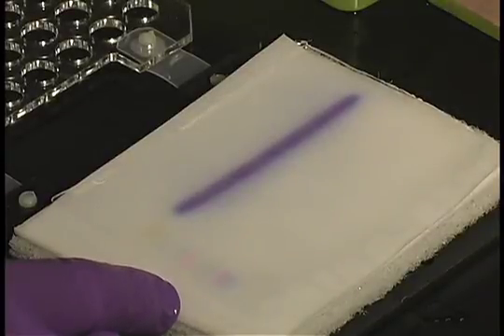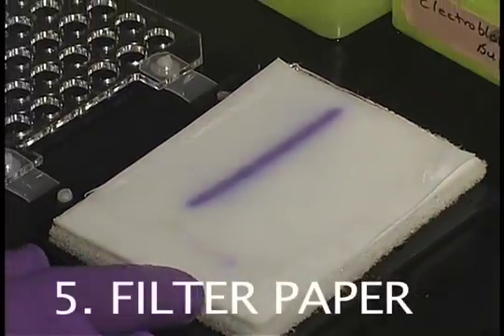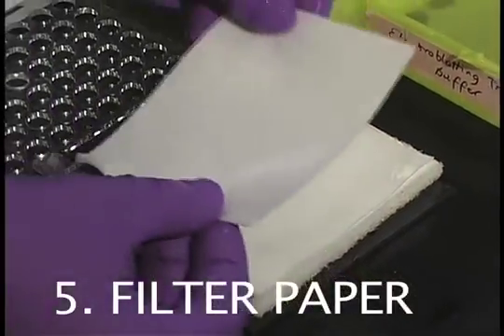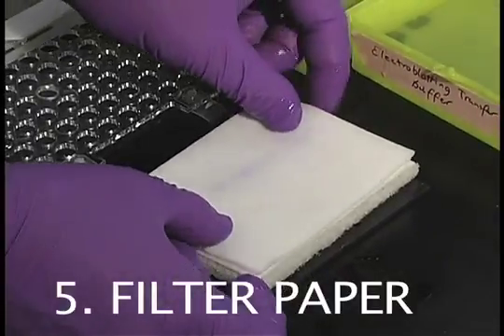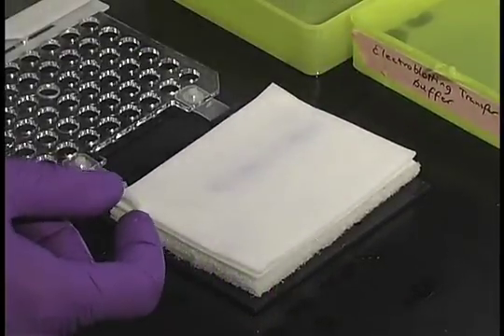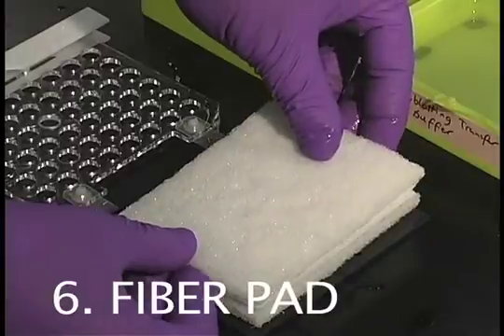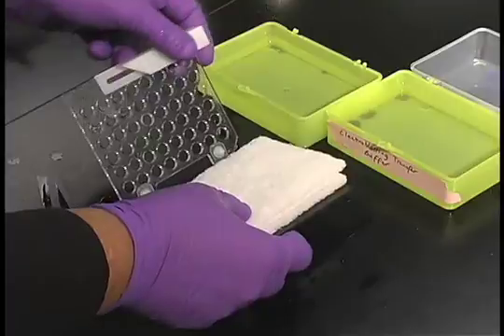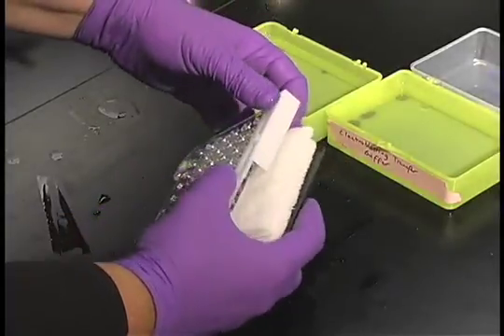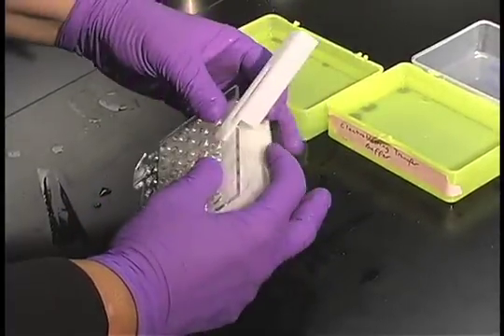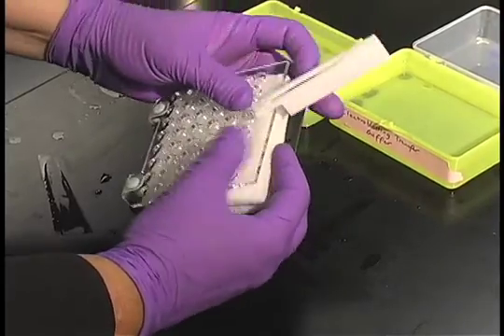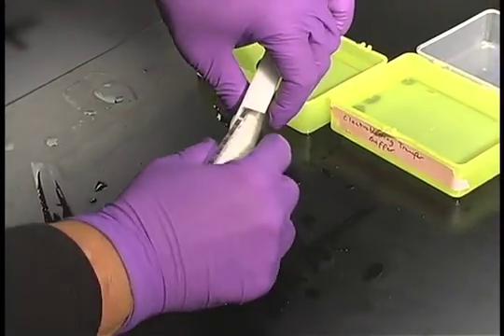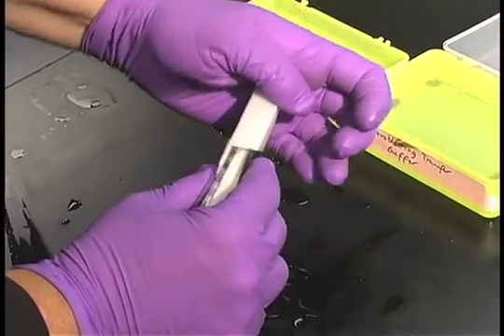Follow that with another piece of filter paper and the second fiber pad. We will then sandwich the cartridge in place. Squeeze this in place and lock it as such.